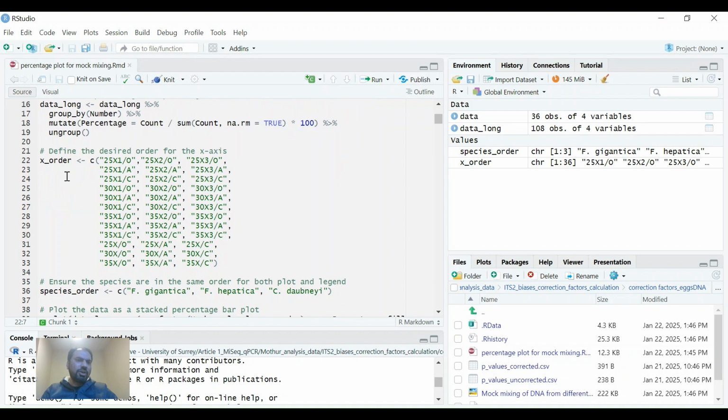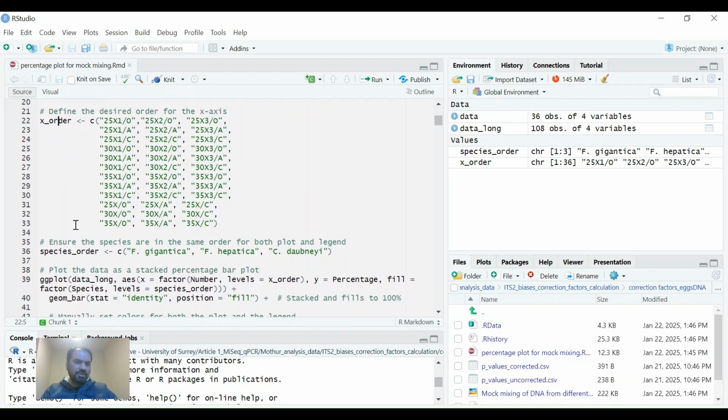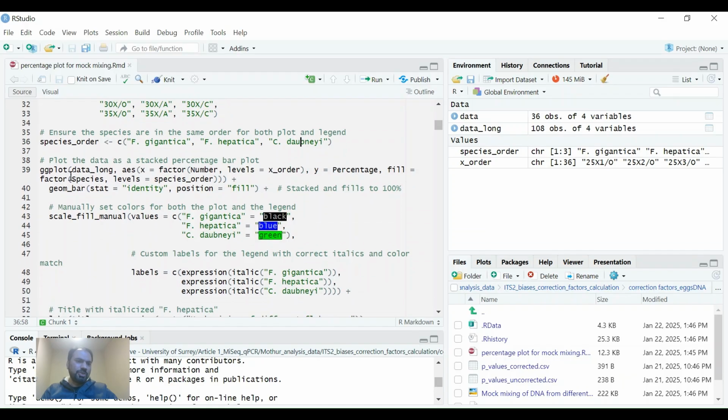And then this is the important point here. I have made an X ordering. On the X axis, I have generated an order that first of all, it will show you the 25X bars, the observed with observed reads, then with 25x the actual reads, and then the corrected reads, and likewise with the other numbers of cycles of PCR. So we can make ordering of the x-axis. If we go further down, then we give it species order. We have 3 species: Fasciola gigantica, Fasciola hepatica, and Calicophoron daubneyi.